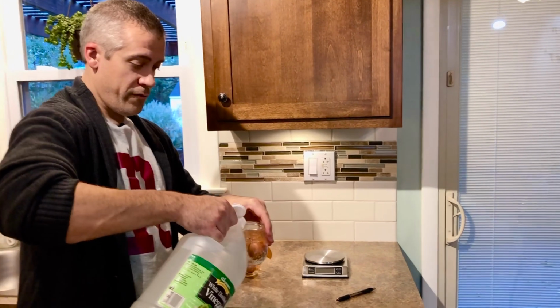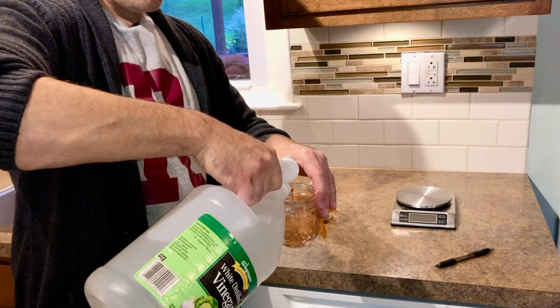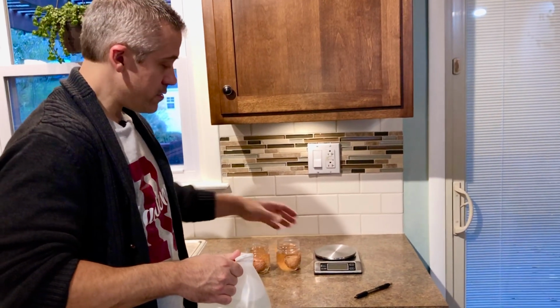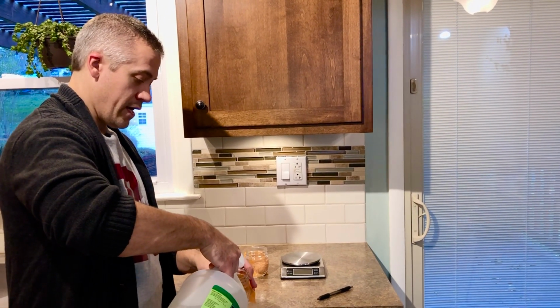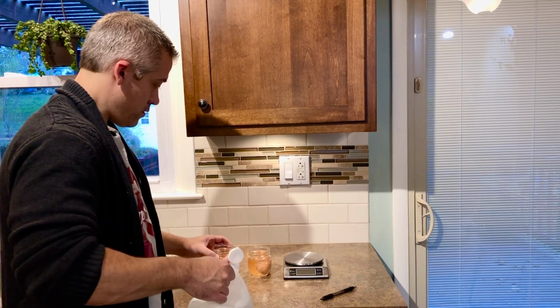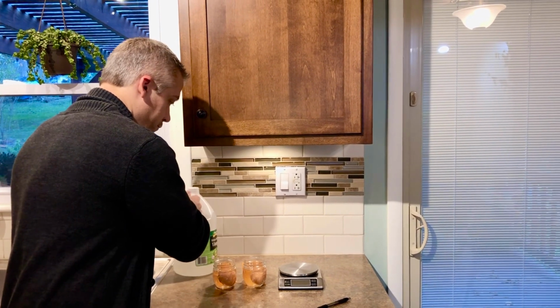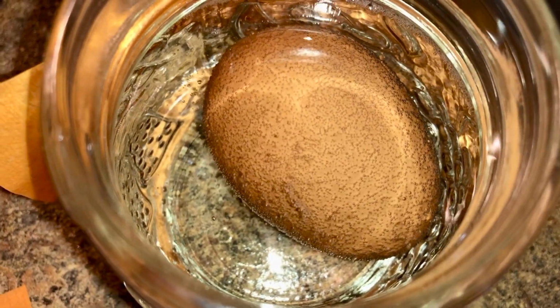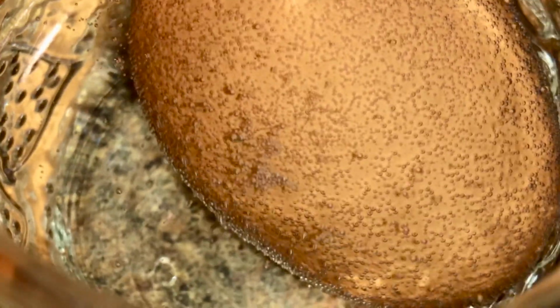All I'm going to do is fill in enough vinegar so that it just barely covers the egg. And your egg may float a little bit, and that's okay. So just until it starts to float or until the egg is completely covered. The amount is not terribly important. Right away we can see the chemical reaction taking place. All those bubbles that you see, that's carbon dioxide.